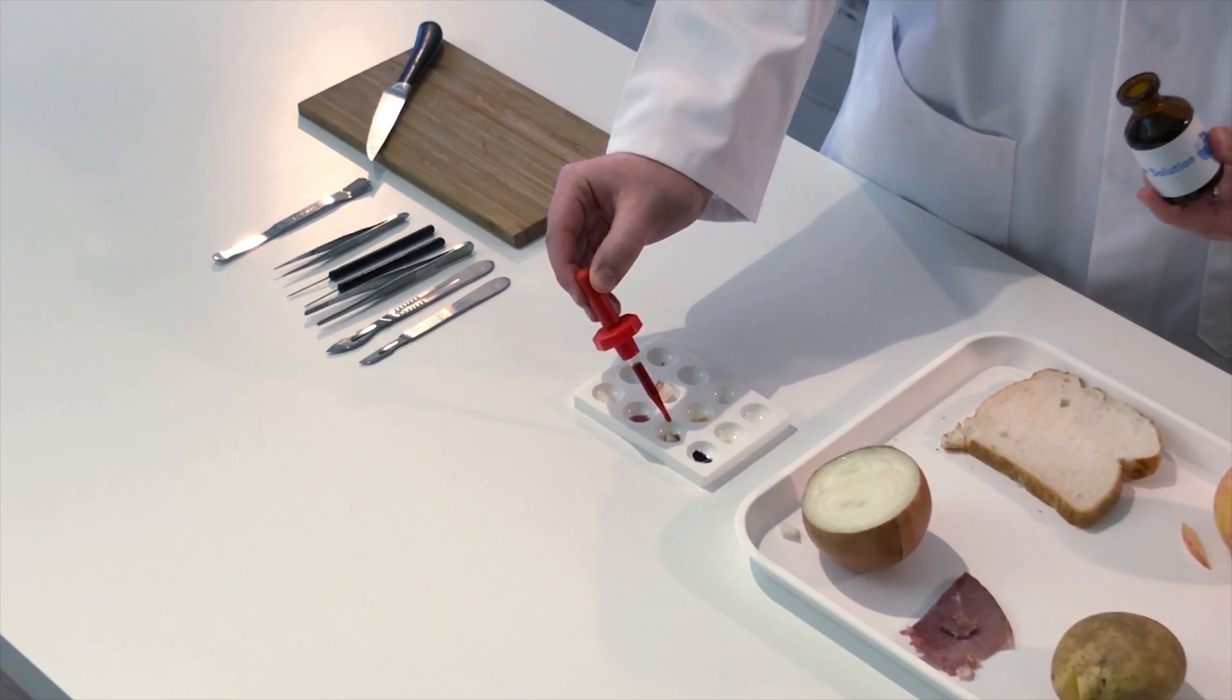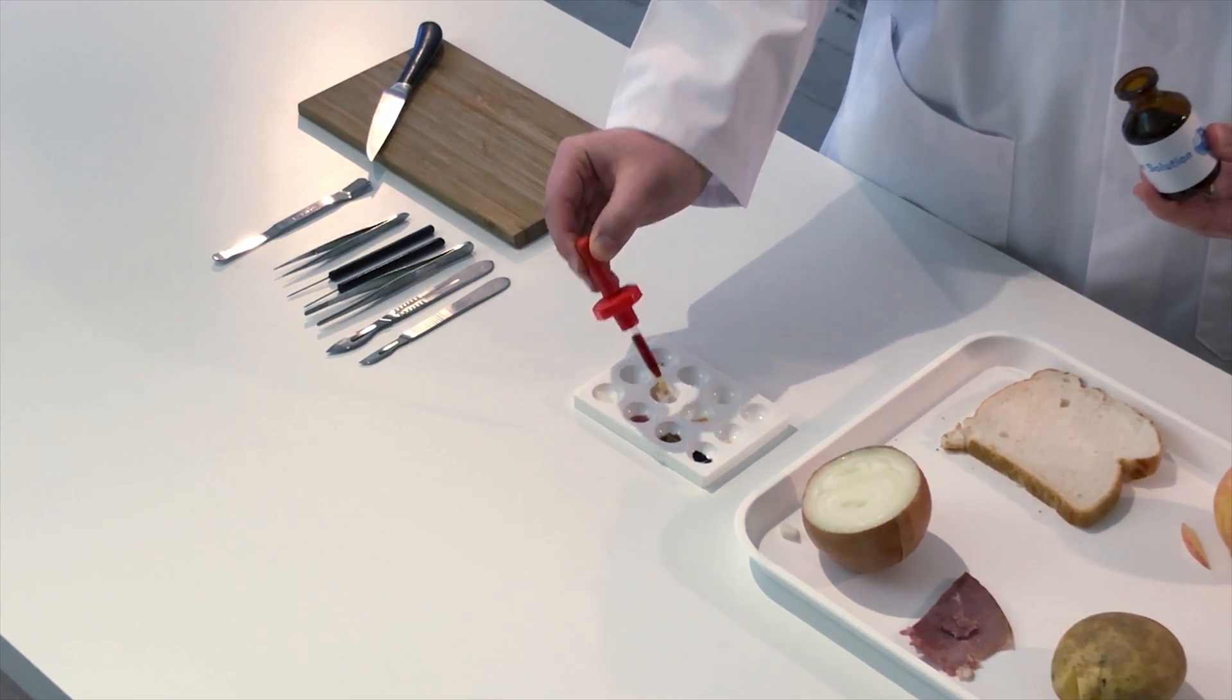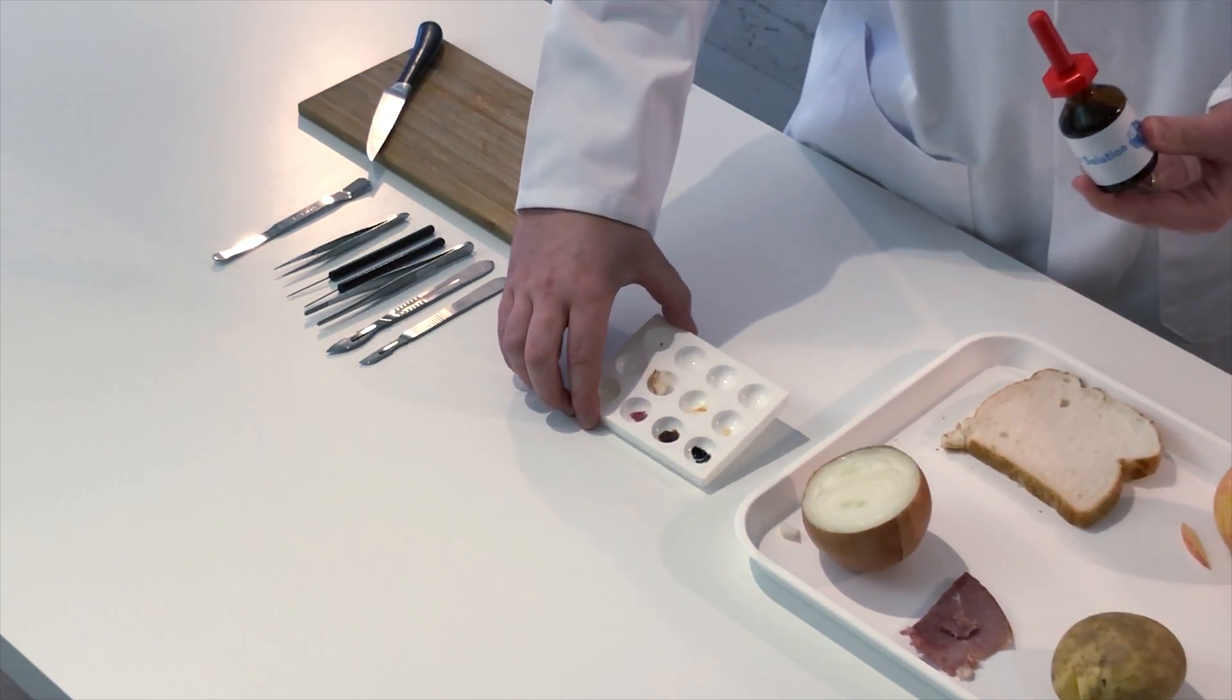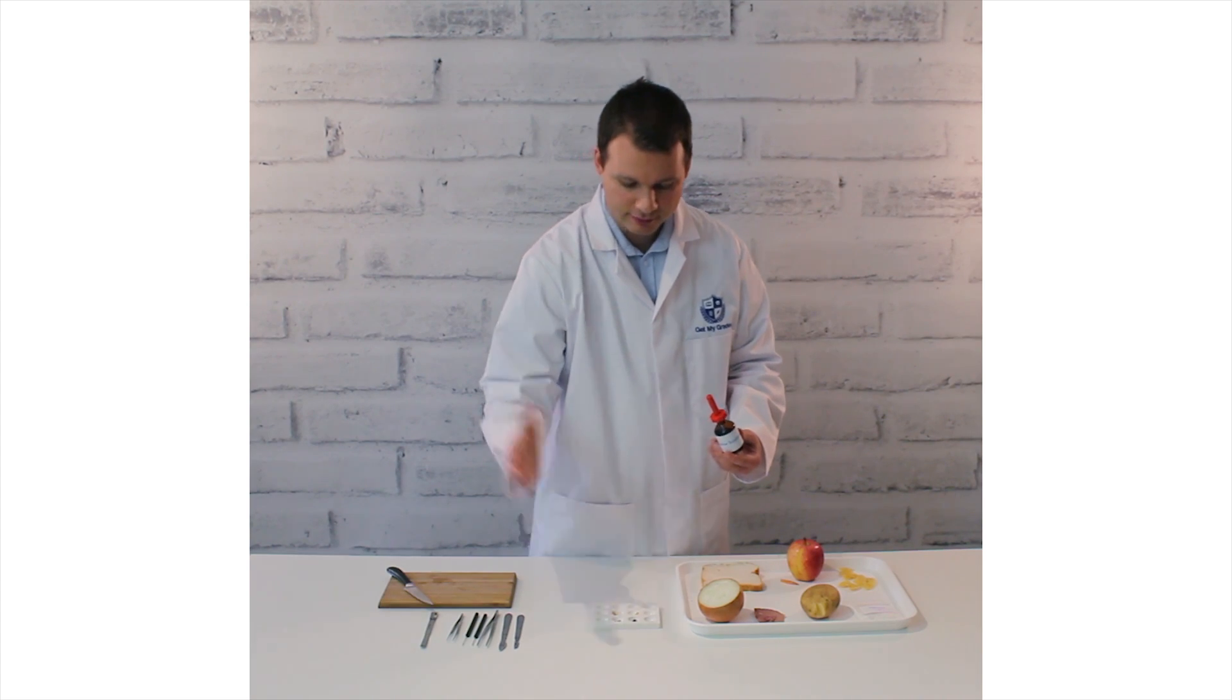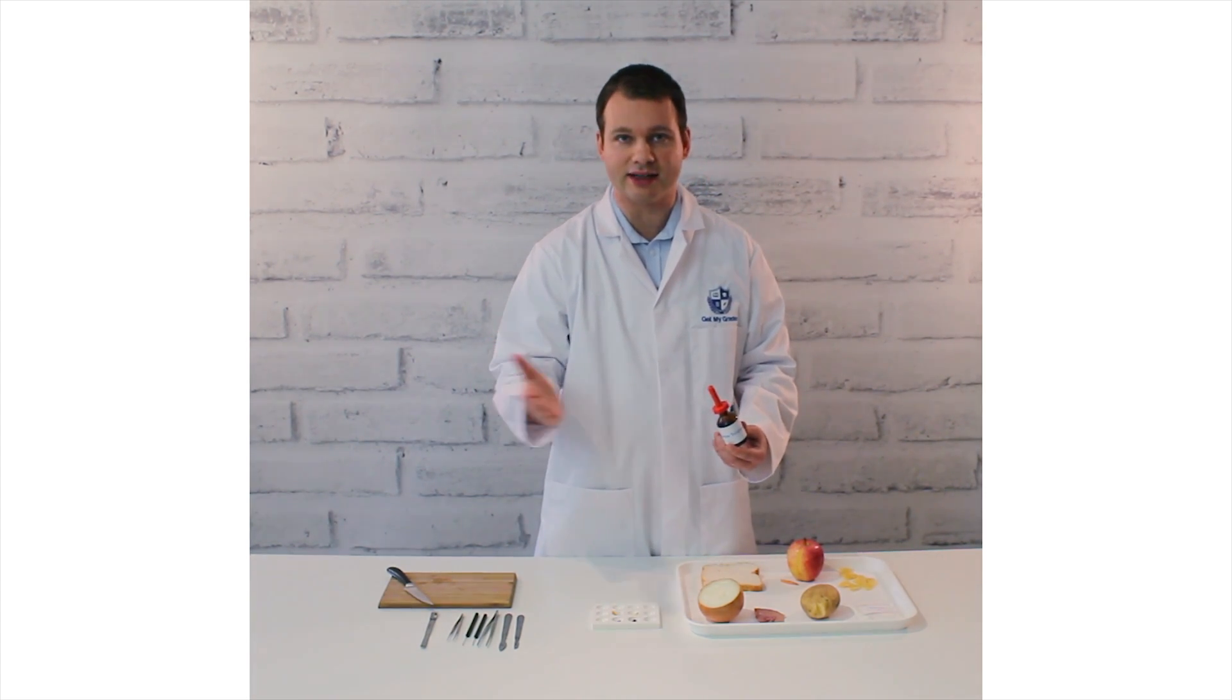Right, let's try for the potato. Blue-black color straight away. Nice, very nice. So the potato obviously has starch.